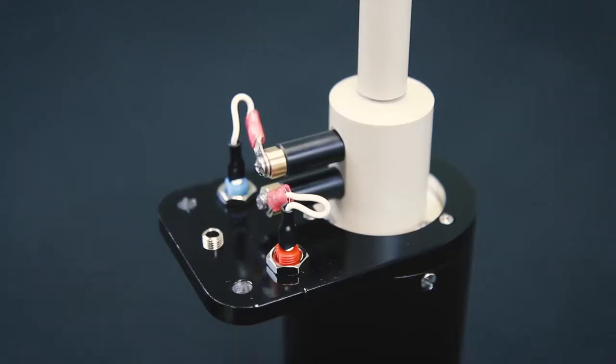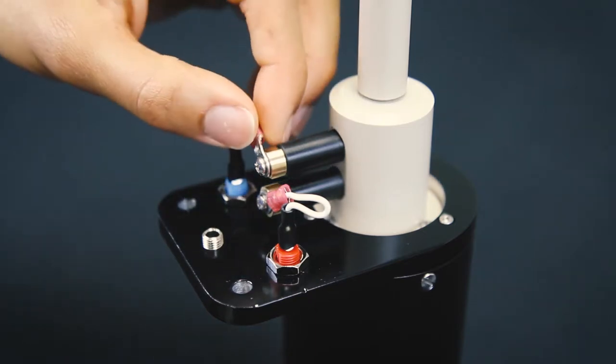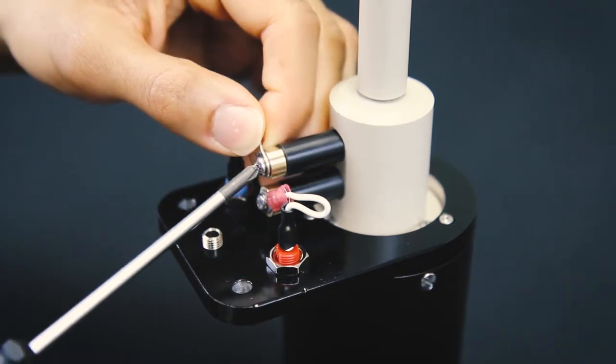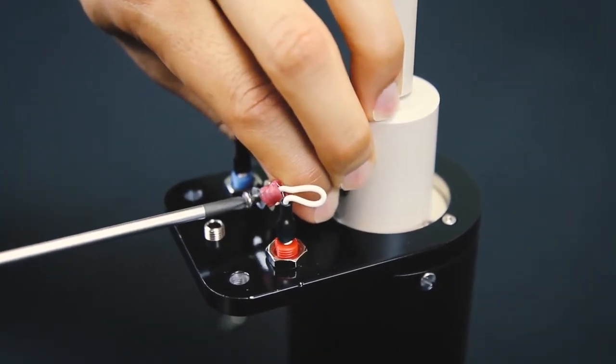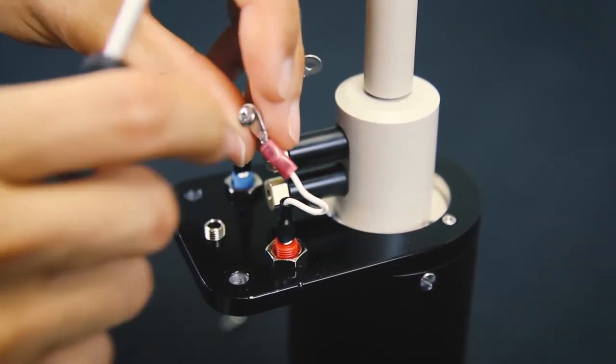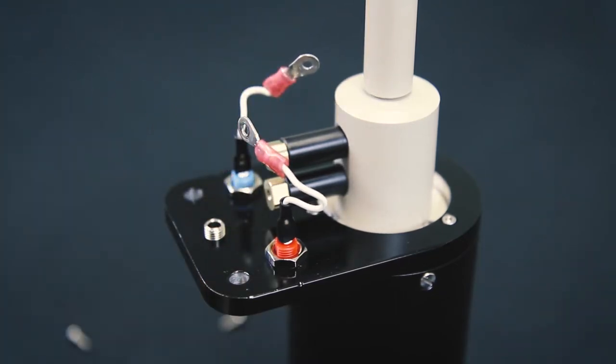Next, remove the screws that connect the wires to the ring and disc brushes. Before removing them, take note of the crimp orientation. Both crimps should be in the same orientation when reassembling the Wave Vortex. Once the screws are removed, unscrew the two brushes with your fingers.